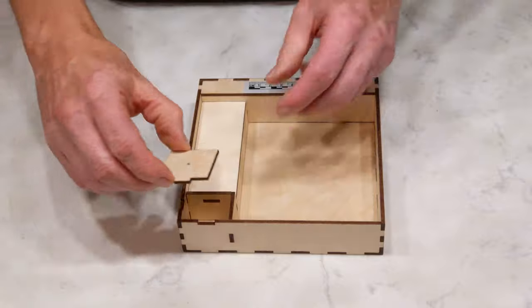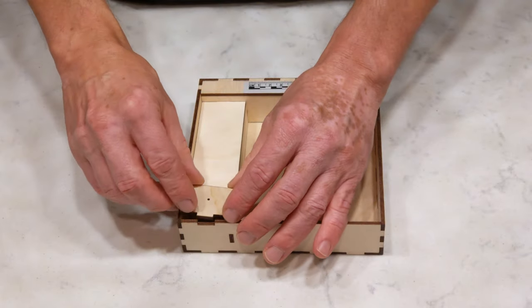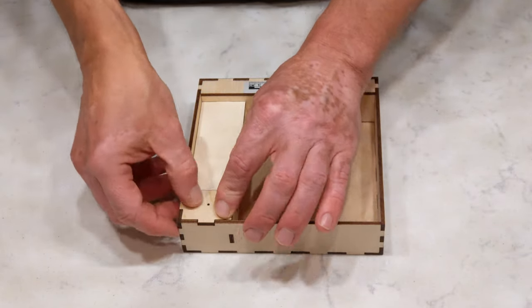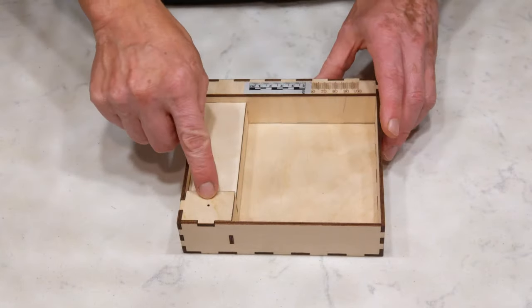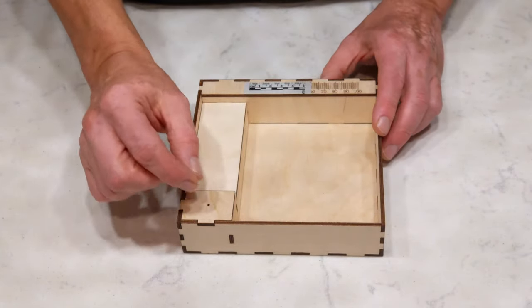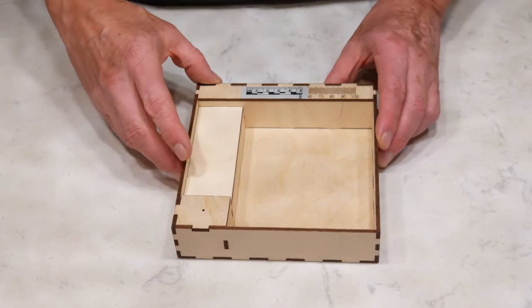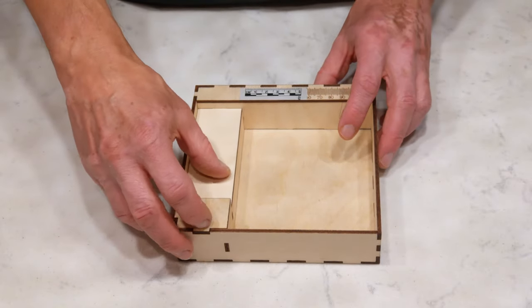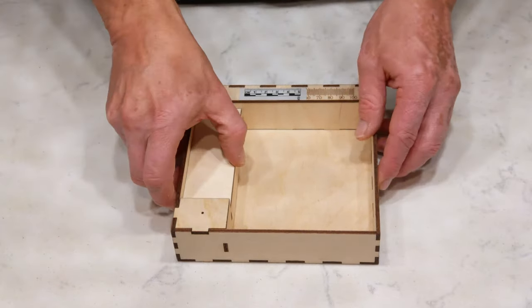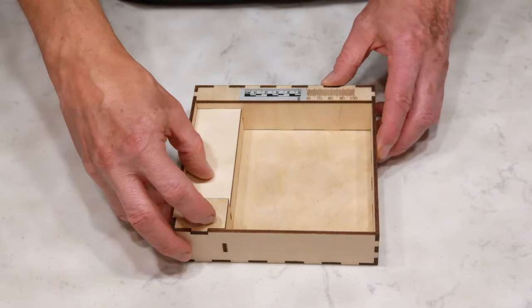And then finally, this little piece is going to fit right here. And this hole we use for pushing the pins through to move the labels up if you don't want to use a pinning block.